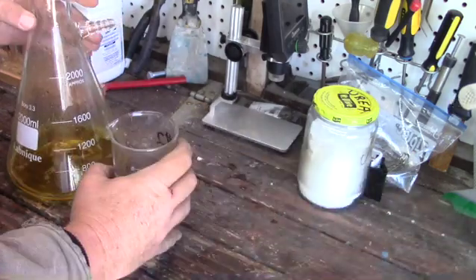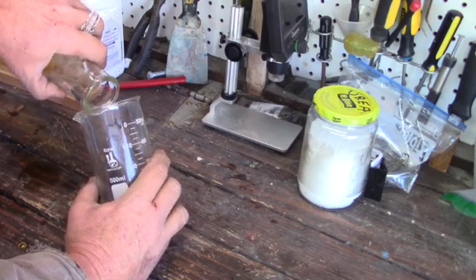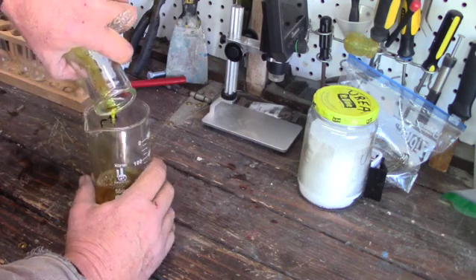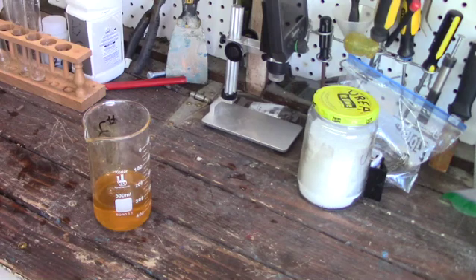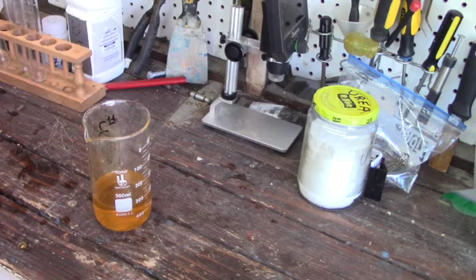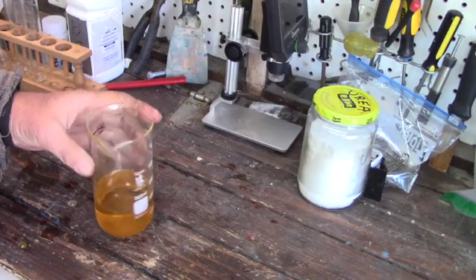Now what I've done here is I've mixed all of our leftover solution together, ran it through the filter again, and we're going to combine it all into one beaker. Add some SMB — sodium metabisulfite — and hopefully precipitate out some gold. Nice clear solution; hopefully we got gold in it and hopefully we can get it out.